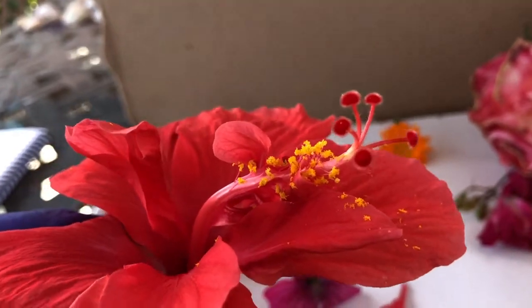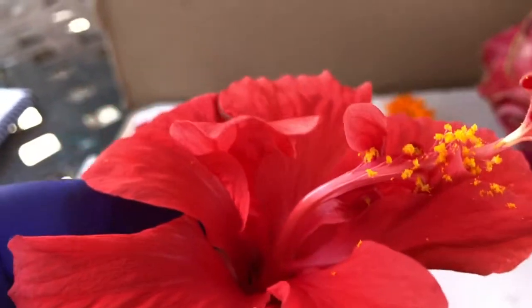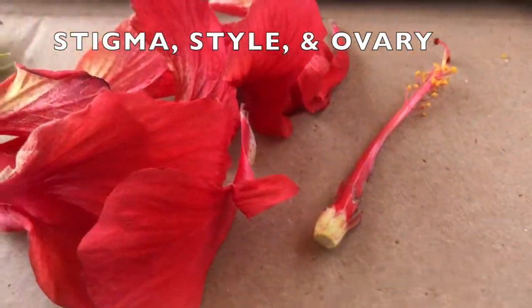And so the pistil itself is actually comprised of three different things. So it's the stigma, the style, and the ovary. And so I'll show you really quick here.